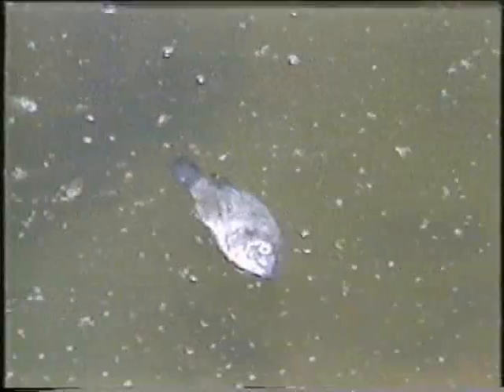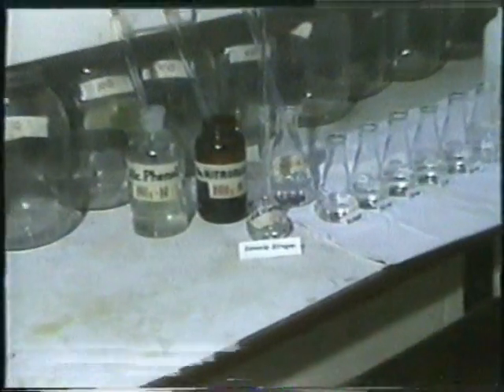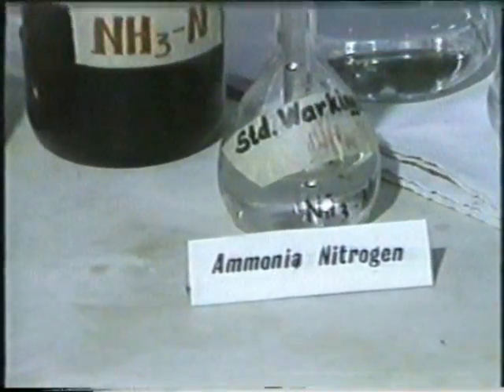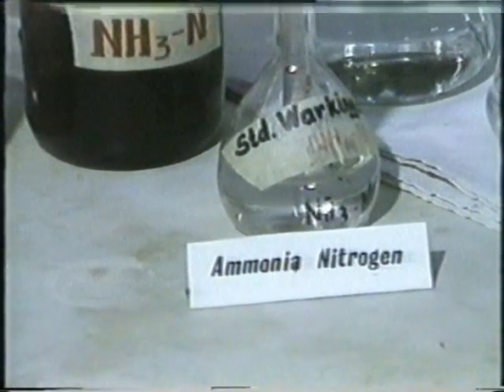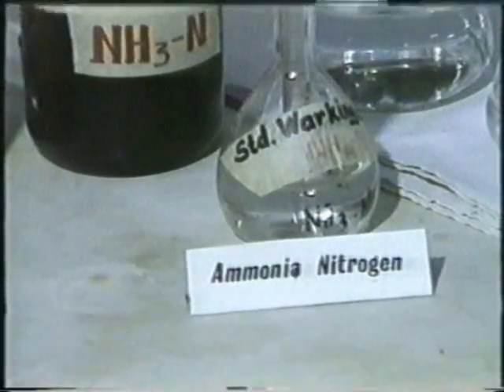Lethal effects are usually observed at concentrations between 100 and 300 parts per billion. Determining the amount, which is expressed as nitrogen ammonia, is therefore of utmost importance to the fish culturist.